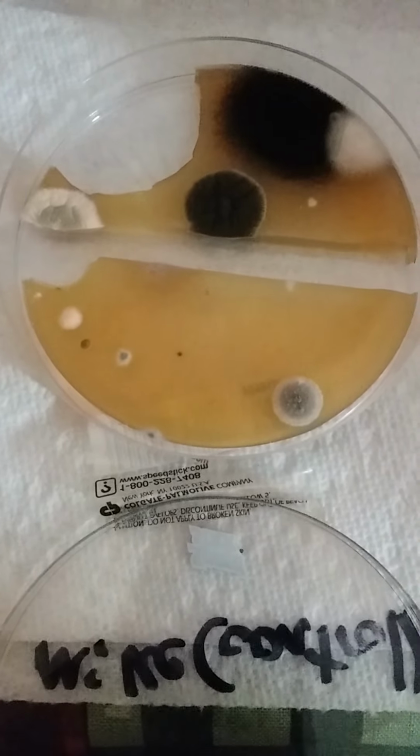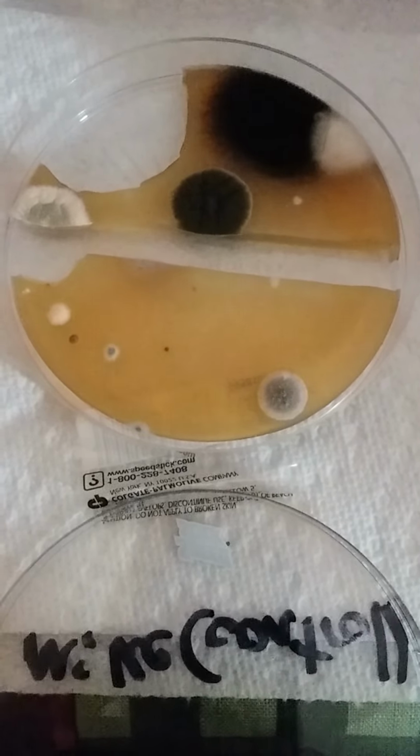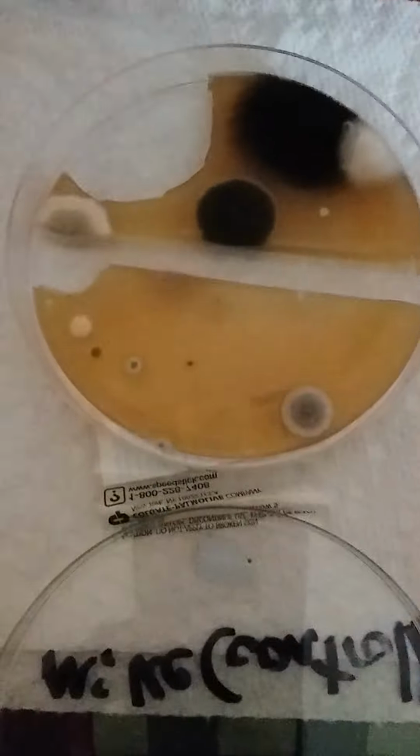But since ampicillin, I believe, is derived from penicillin, which is derived from fungus or mold, well, anyway, it's not going to inhibit the growth of mold. What's interesting to me is that the mold seems to have formed on Zach's side much more than, and maybe cross-contaminated to my side. And you'll also note where I cut out some pieces of the agar media.